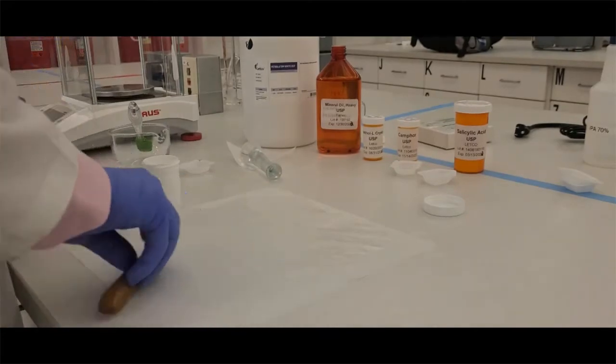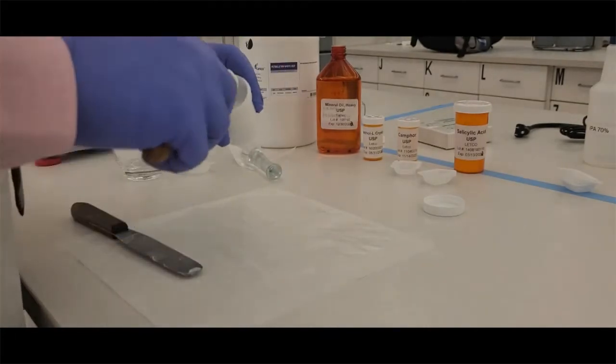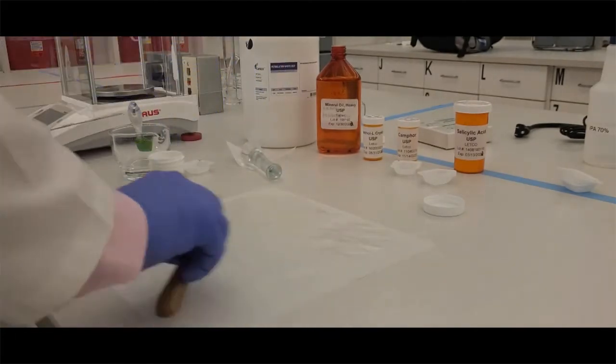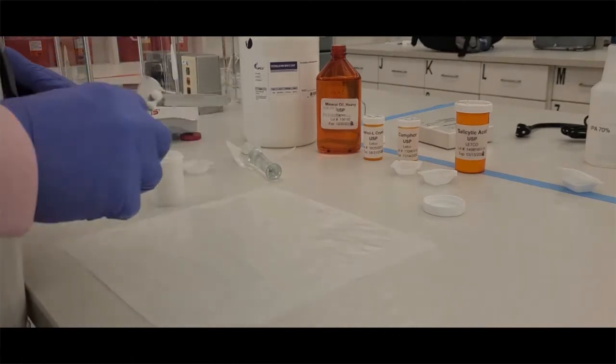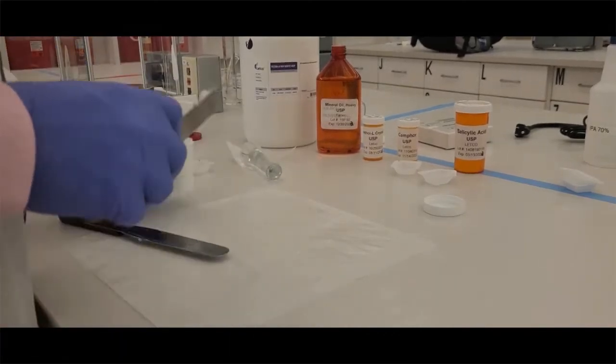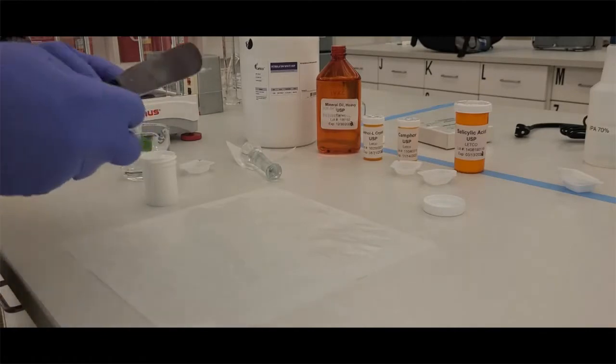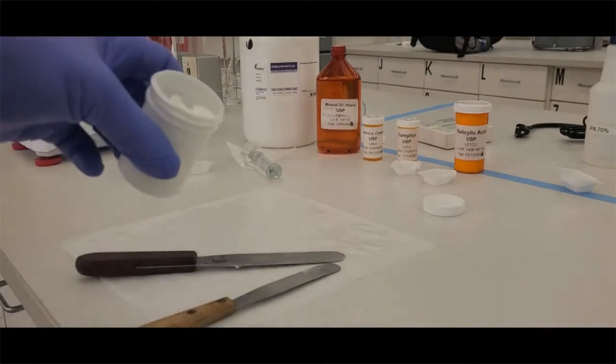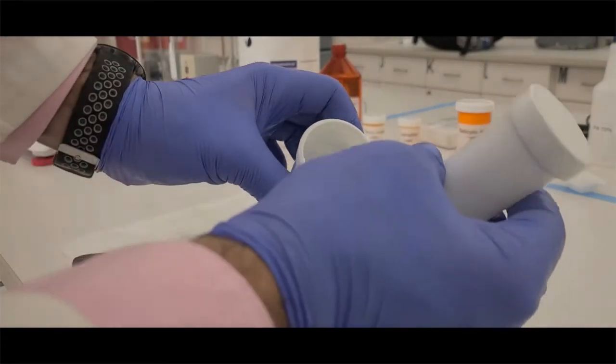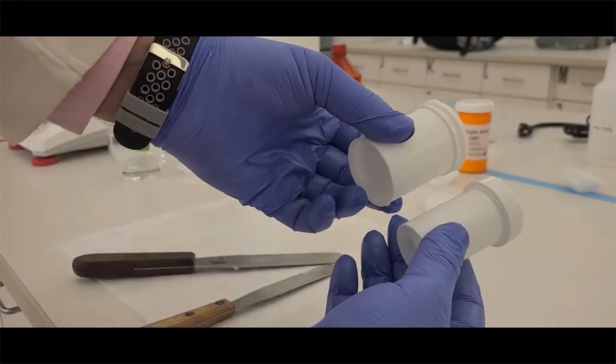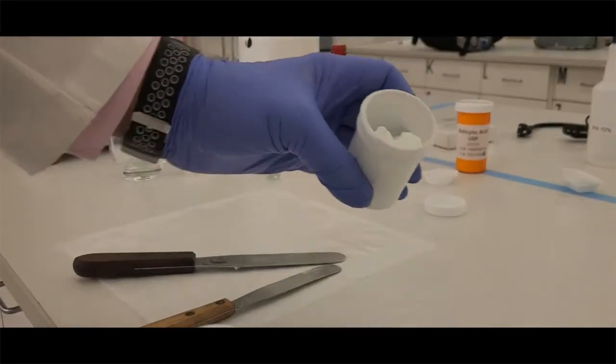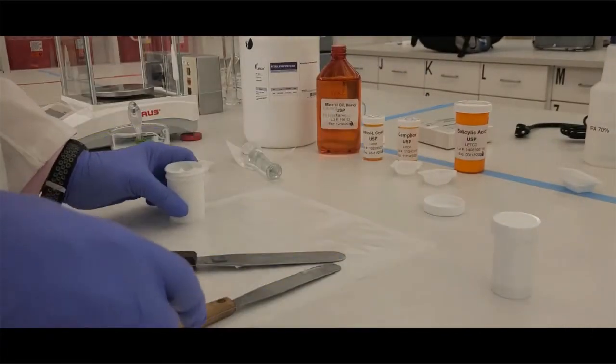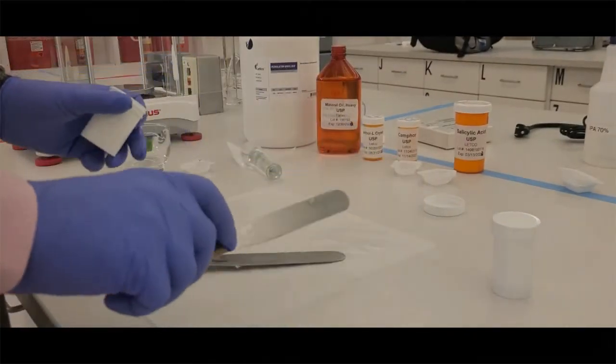You're trying to get as much as you can. Remember, we're trying to recover 100%, which is going to be nearly impossible. But we want to do an experiment here to determine how much loss we actually get when we make this so that next time we know how much more to make to incorporate for that loss. So once I have everything in the ointment jar, you'll notice it doesn't look elegant. It's not pharmaceutically elegant. You might want to use the smaller container that you'll have in lab, but I want to show you visually here better with a larger two-ounce jar.